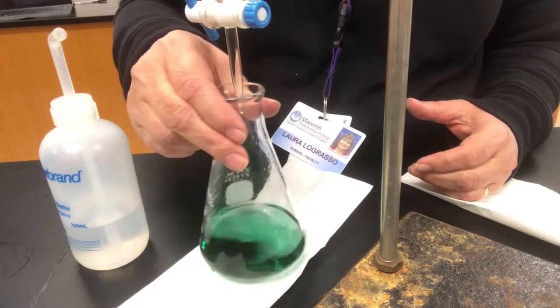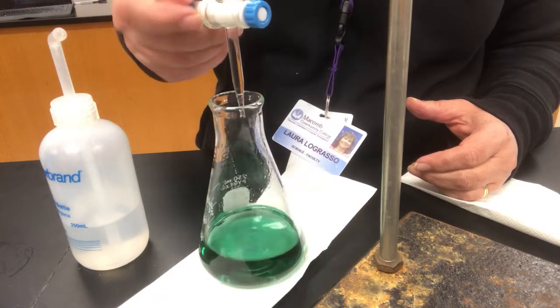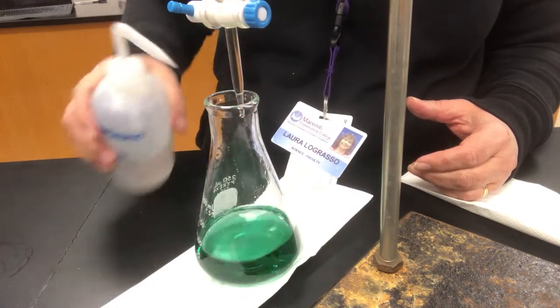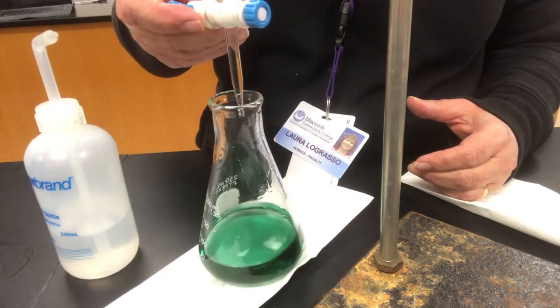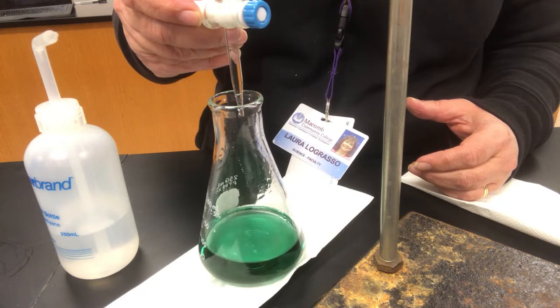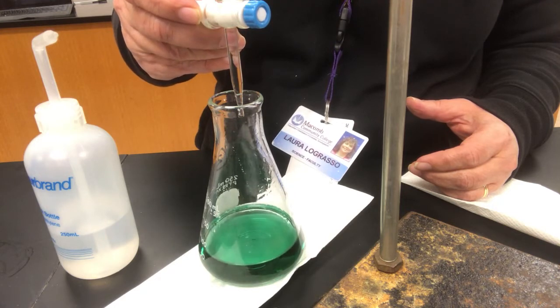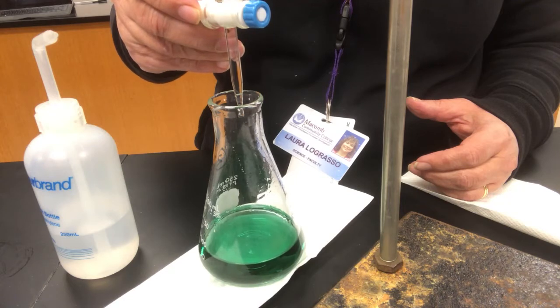Okay, so here I am going dropwise. This time I'm going to be really watching it so that I don't accidentally put in a squirt rather than turning it off. So I'm turning it towards me to get it to drop. That means I have to turn it away from me to get it to stop. Come on.